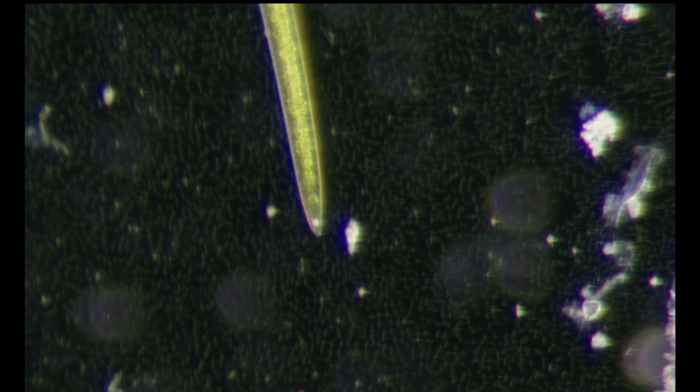And why can't I see it? Just a sec. Oh, I think it's on the zoom. Okay.